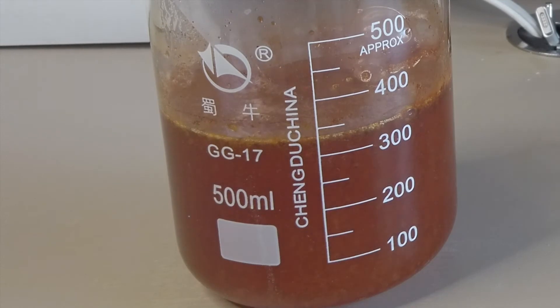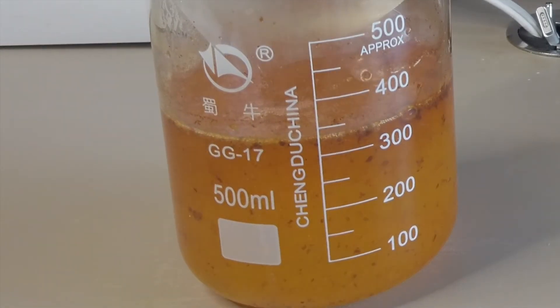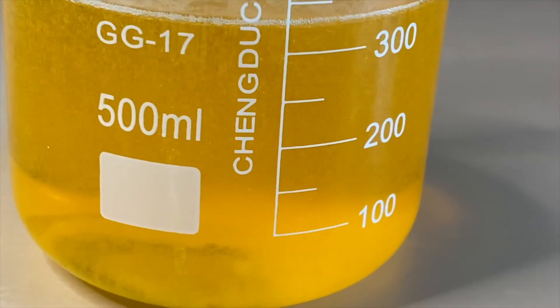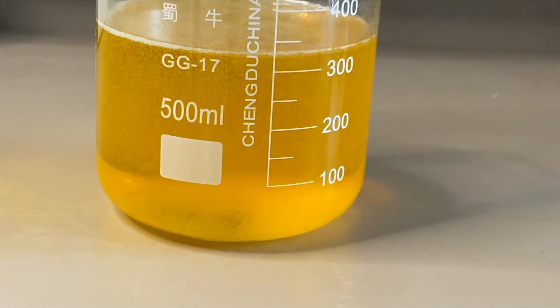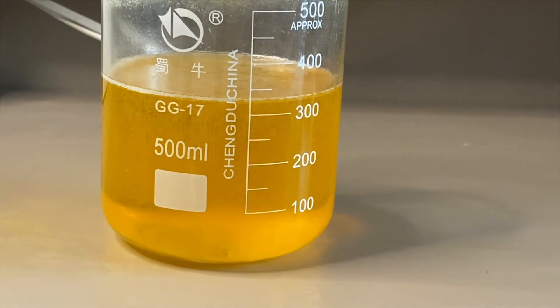Then it slowly reverted back to bright golden yellow resembling the color of beer. Zooming in a bit you'll see some bubbling occurring in the solution. But still it's not frothy beer.